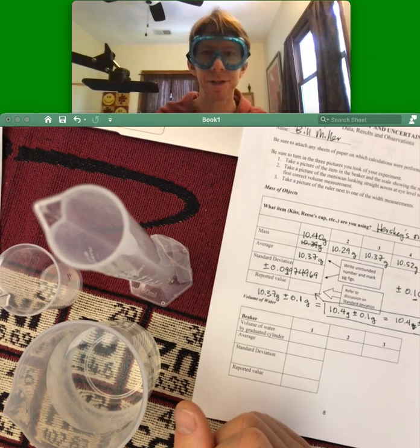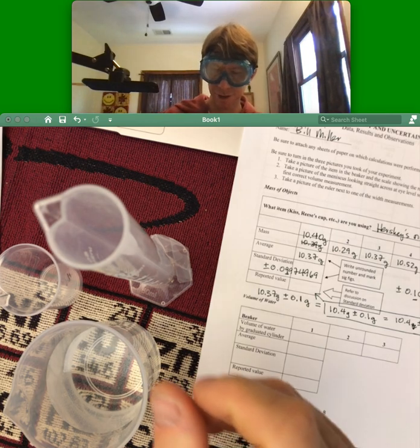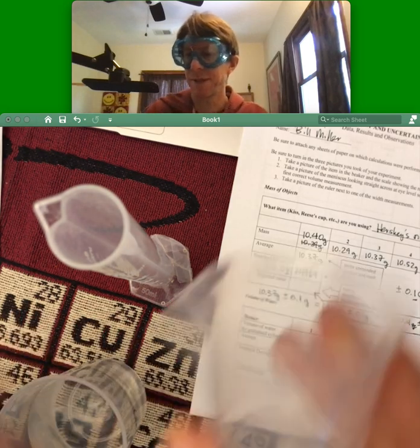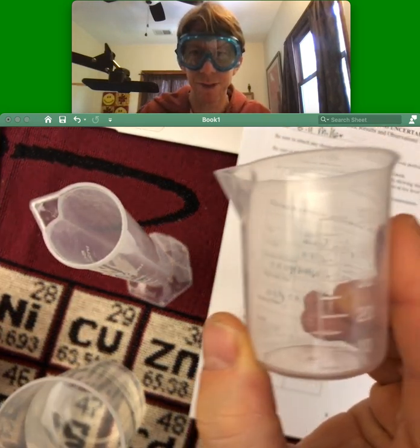Must dry the beaker and the graduated cylinder first. So I'm going to put this in. And my beaker, I should say, has markings of 5 milliliters.